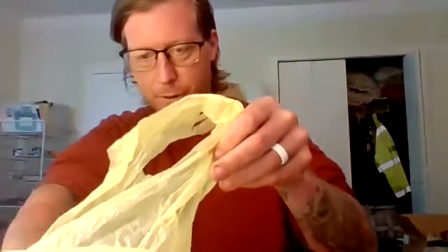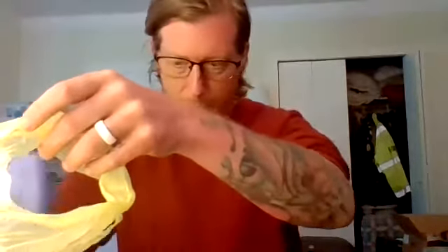Not the best sample. I didn't collect this myself. There's hay in it. I can see all kinds of stuff in here. And I can tell the animals are certainly eating hay. This looks like an old sample to me, but we'll do our best, see what we can do. Obviously, the drier the feces, the more it's going to take to get you up to 2 grams. So I'm literally picking hay out of this manure right now because, like I said, when you take the sample, take it in a plastic bag, put it in the fridge, treat it right, because you're only as good as your sample. Okay, there we go, right on the button.